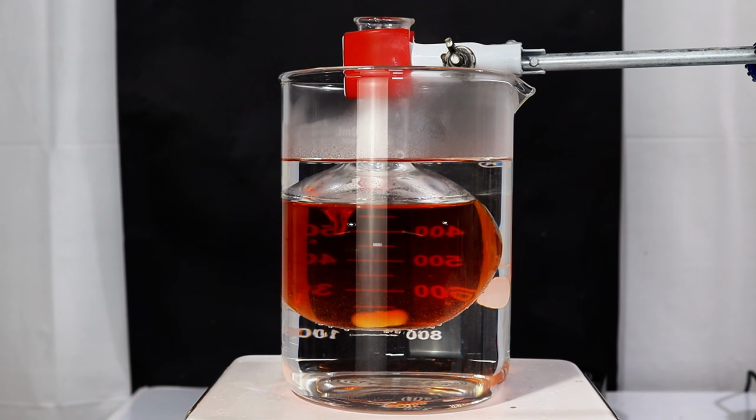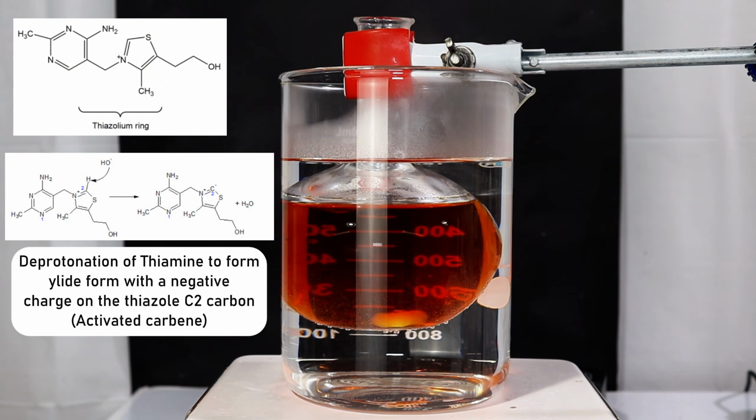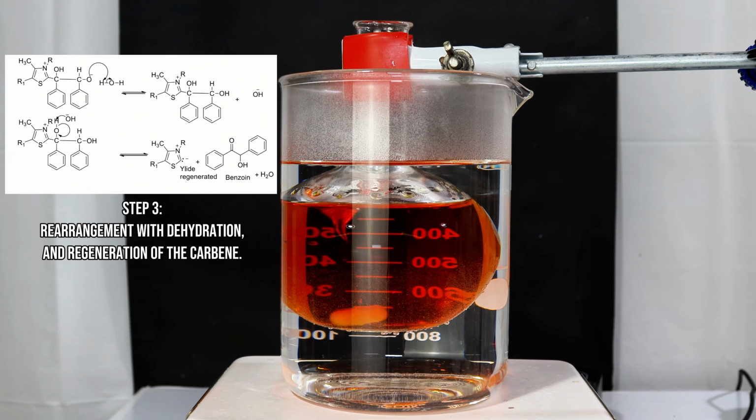Now, the chemically active part of thiamine is the thiazolium ring, which forms a carbene after being deprotonated. The carbene next attacks the benzaldehyde, forming a nucleophilic intermediate that rearranges in such a way that the polarity on the carbonyl is reversed. In another nucleophilic addition, this reactive intermediate attacks a second molecule of benzaldehyde, which subsequently rearranges with a proton transfer and the elimination of the carbene to yield our final product.